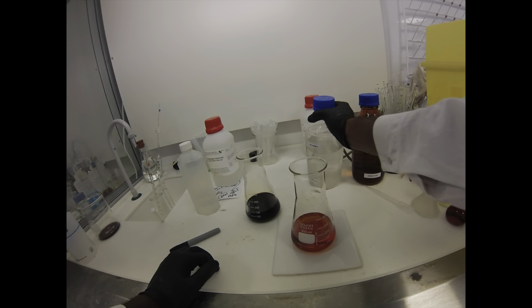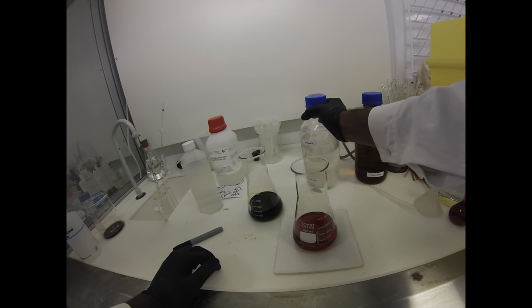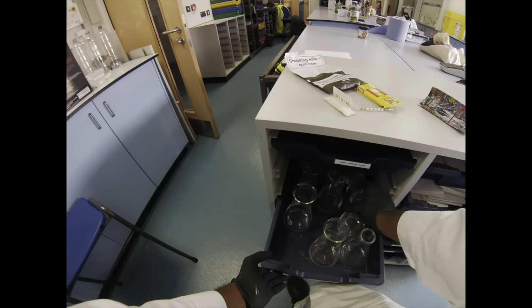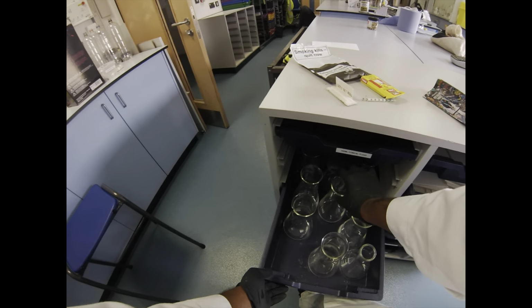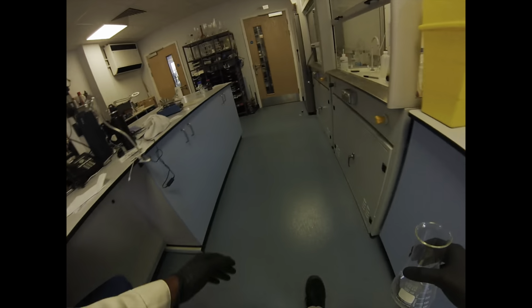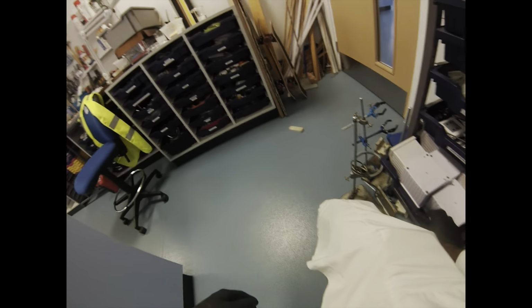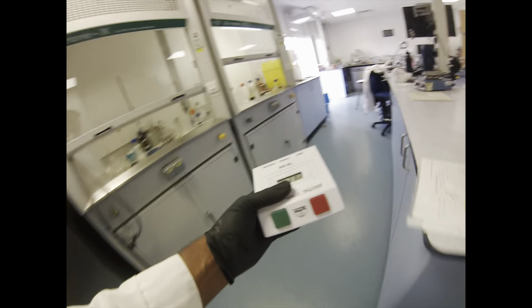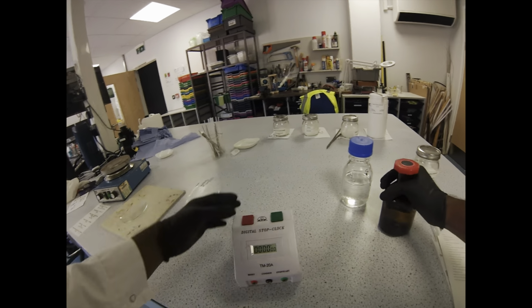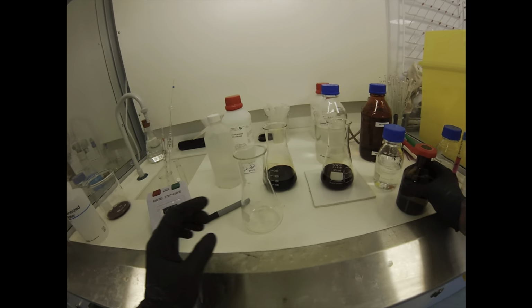Kind of cool, I guess, but not as striking. You can see the starch has been eaten up already, so you're just getting iodine being formed now. Okay, so now we're going to look at timing. So let's get a new conical flask and let's go again. This will be more for an investigation or a practical if you want to look at rates or if you want to look at rate order. Using these ridiculously oversized stop clocks. Much better than stopwatches though, they are completely bulletproof.